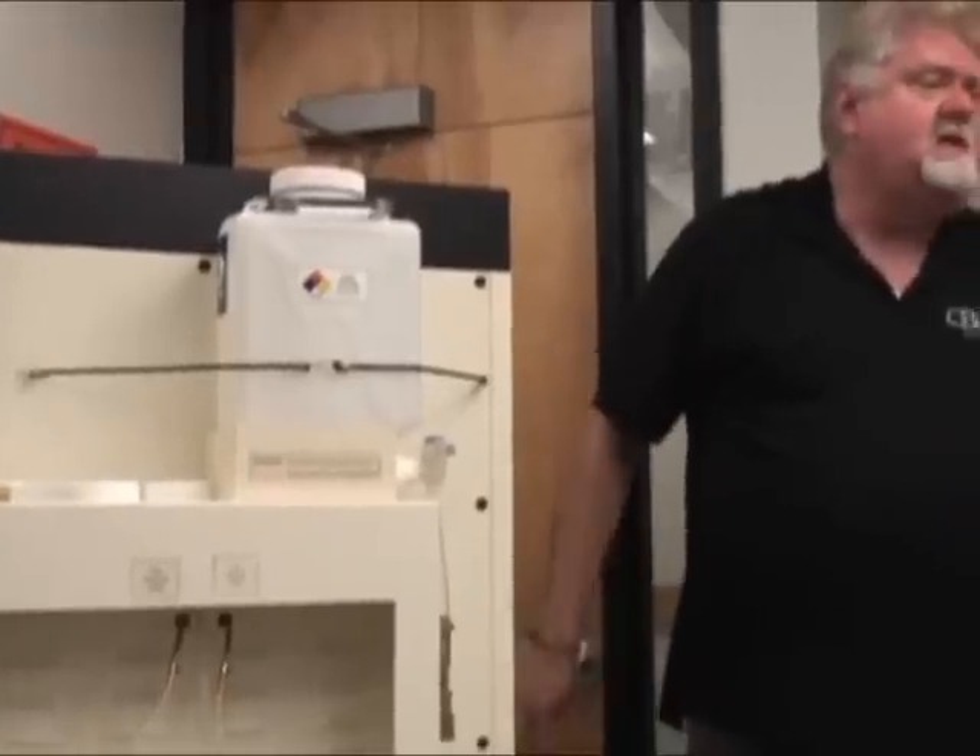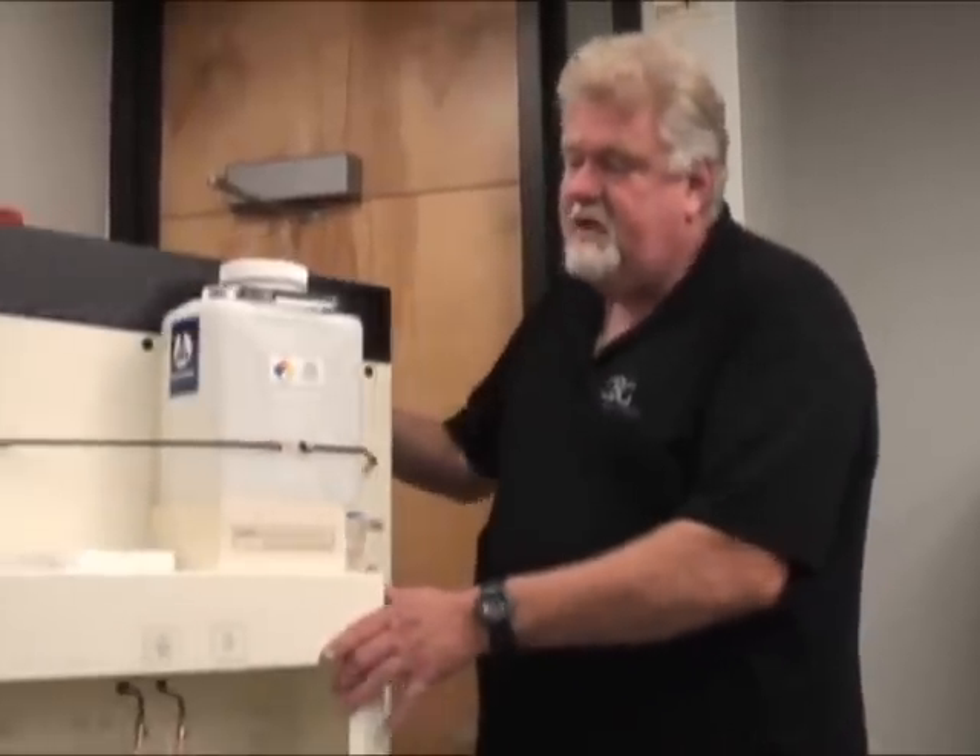What's going to happen is it's going to feed down inside this machine into a stainless steel tank wrapped in insulation. There's no external heat, only internal heat — so this unit doesn't heat up your walls or your lab area whatsoever. First thing it's going to extract is your ethanol waste — the water and alcohol that's in your system, which is your primary contaminant of xylene.